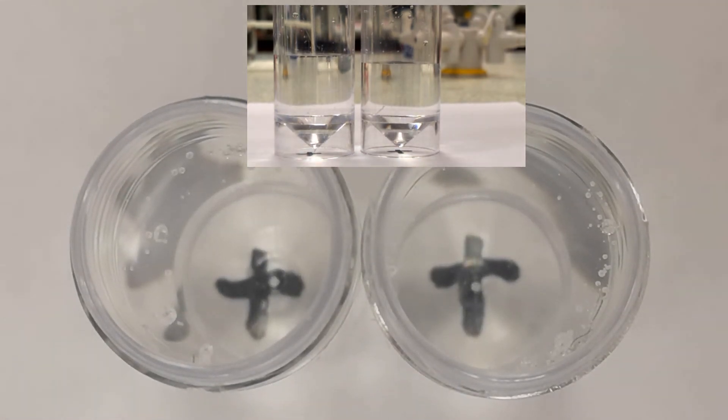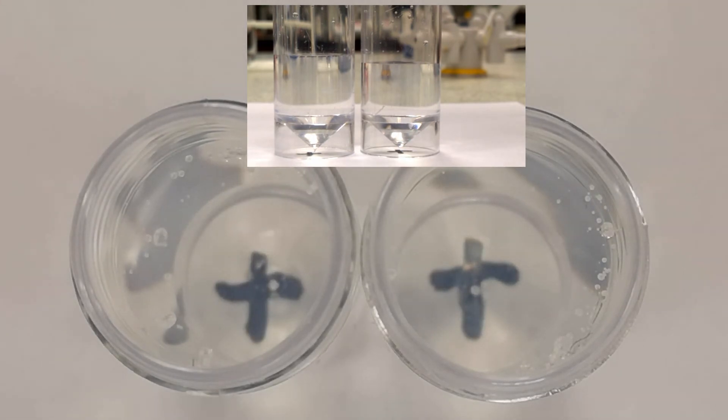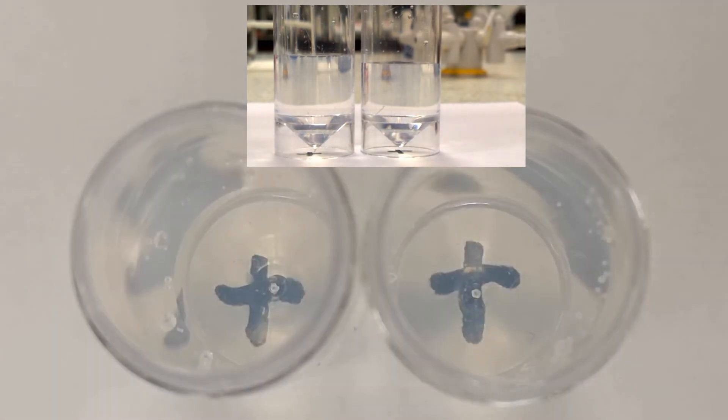The solution on the left has a higher concentration of thiosulfate and, as you will see, it goes cloudier more rapidly.